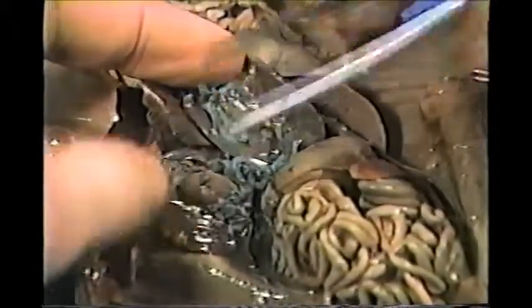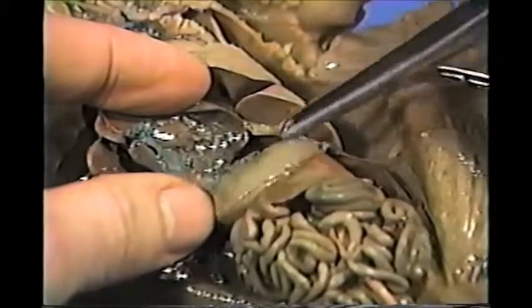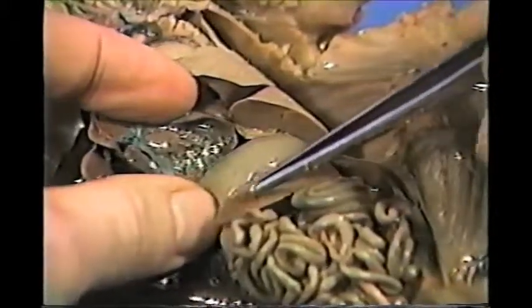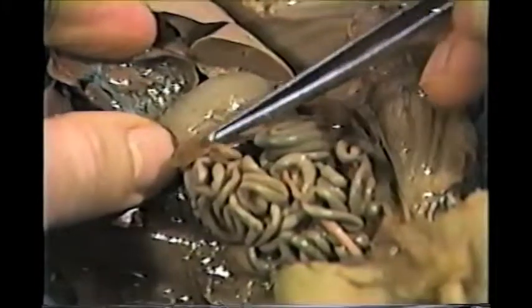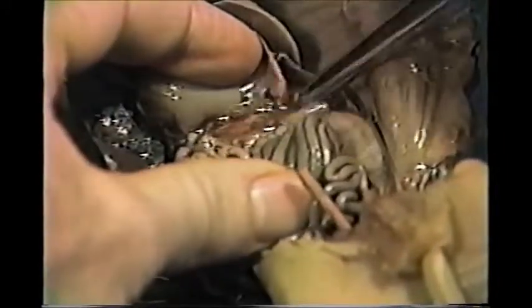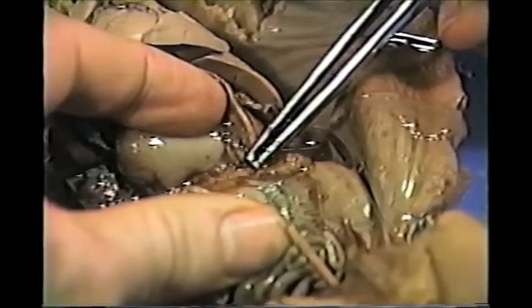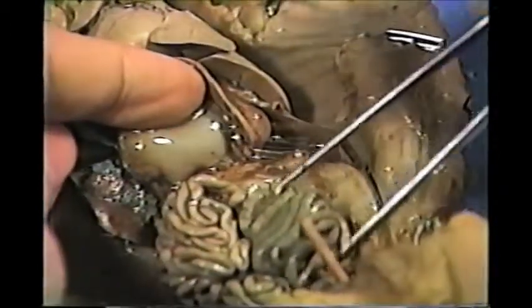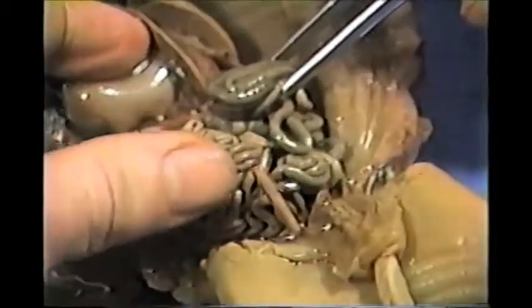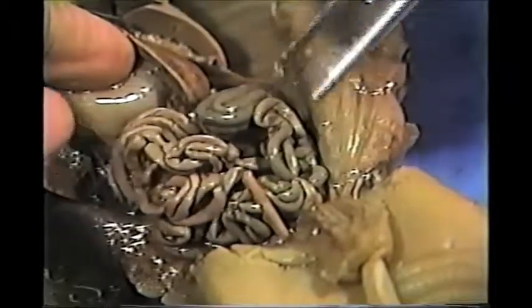That's the gallbladder. This is the stomach right here. It looks like there's some fluid in the stomach. This brown structure is the spleen. If we pull the stomach and spleen back, I don't know if you can see this very clearly, but right in here there's some white stuff. That is the pancreas. We have the large intestines here and the small intestines here. You can see the difference, why these are called small and those large.